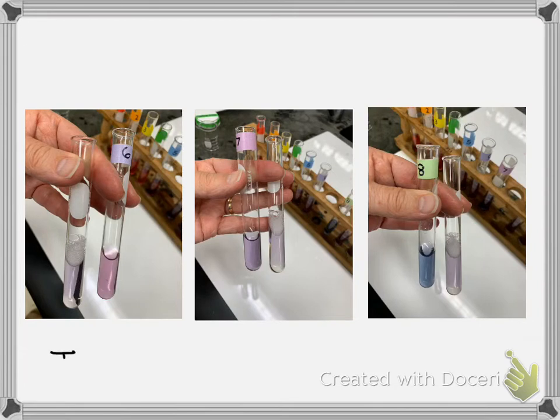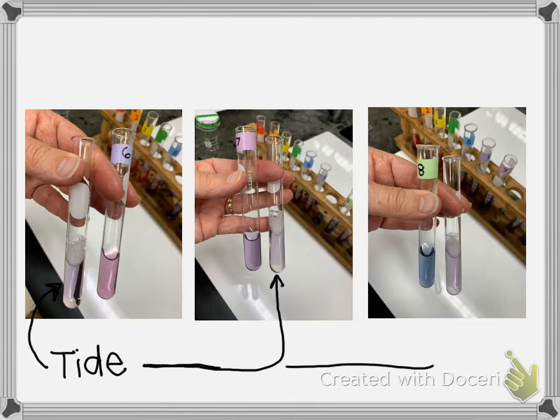And then this one is the Tide. It is a clear and free Tide. The colored Tide would be, again, kind of difficult. You can see how it would maybe mask the color. Now in this case, it's the one on the right that is the Tide. And so I compared it to 6, 7, and 8. I held them close there because the color was harder to see because of the foaming.